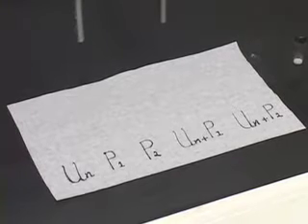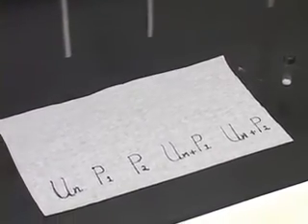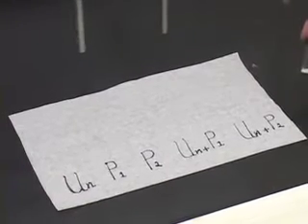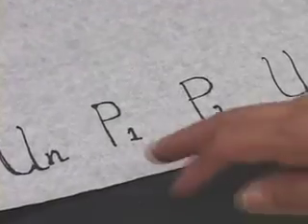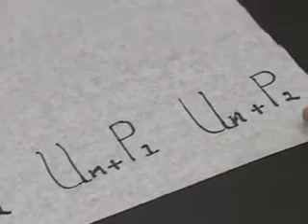From the first part of the experiment, you got a rough idea about the melting point of your unknown compound. From your table of physical constants, you will notice that there will be two compounds which have similar melting points to that of your unknown compound. Those two possibilities I have labelled as P1 and P2. You notice that I have: unknown, P1 (possibility 1), possibility 2, unknown plus possibility 1, and unknown plus possibility 2.